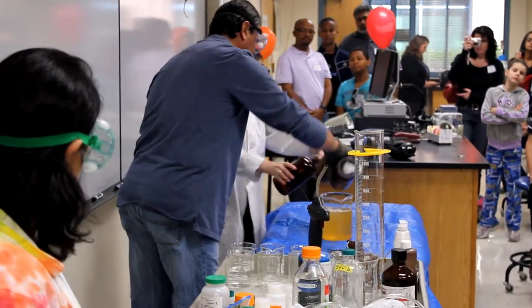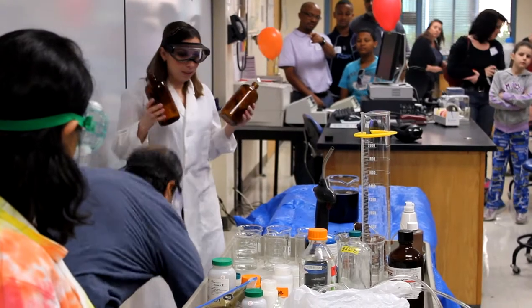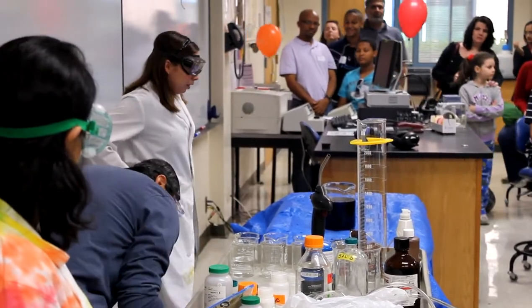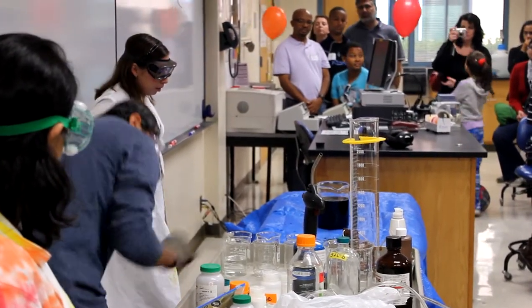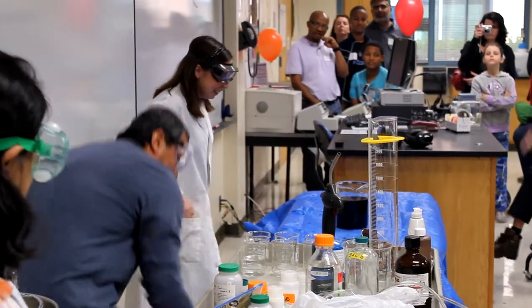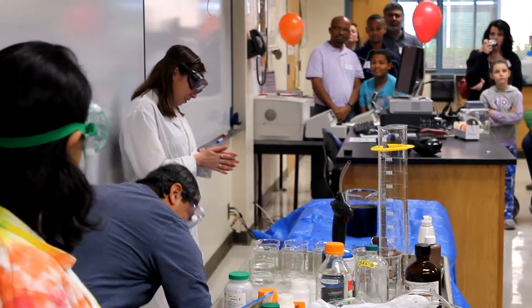Okay, so orange. It's magic. So what's it going to do? Anybody know? There it goes.